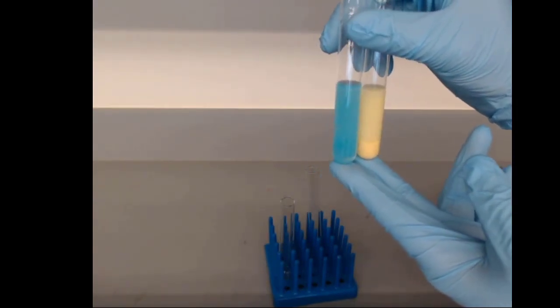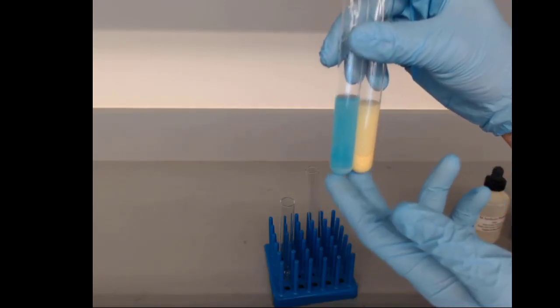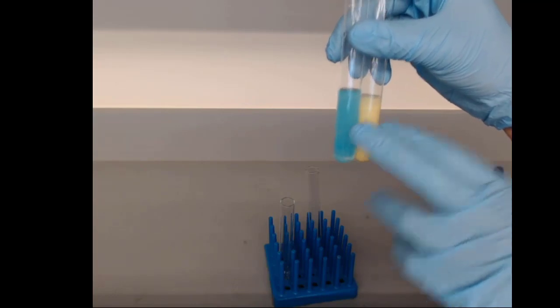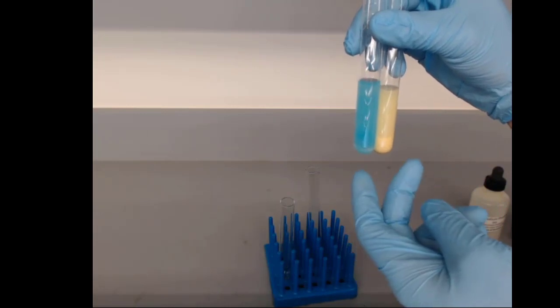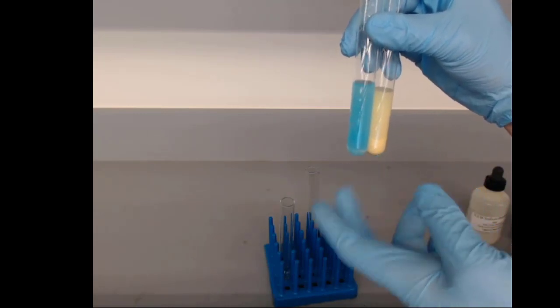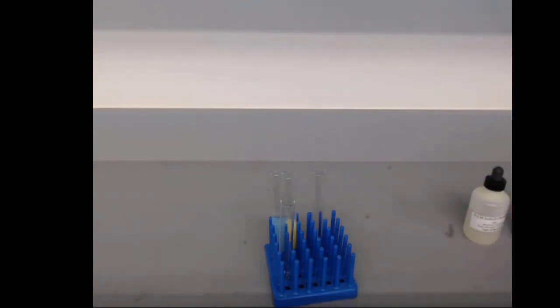When you go to do your types of reactions prediction, you'll want to look for these types of behaviors. Was it two clear solutions? Did solids form? In an observational way to predict whether a reaction is happening or not, or if it's a precipitate reaction.